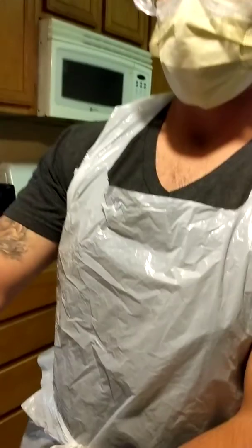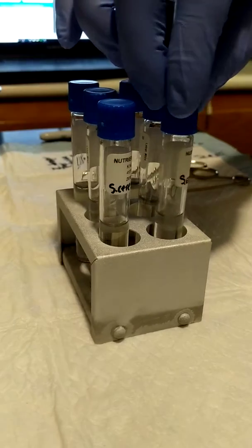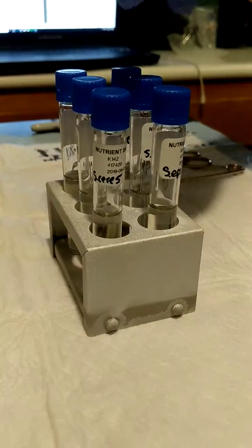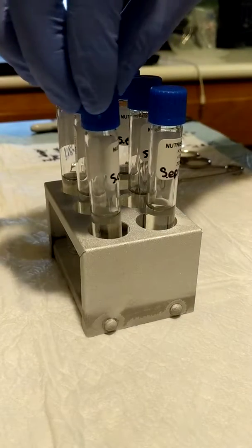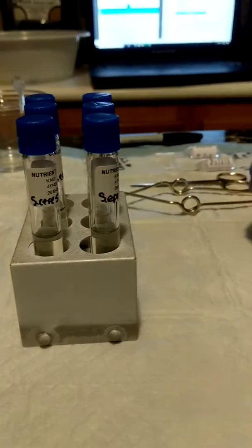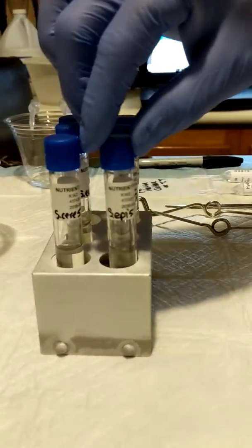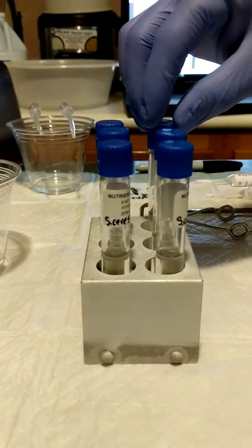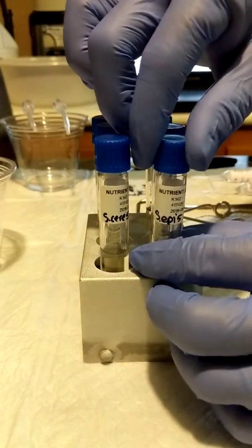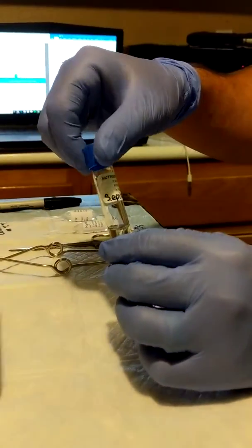So we're going to be testing active cultures incubated in nutrient broths at pHs of 5, 7, and 9. It's going to be testing the Saccharomyces cerevisiae as well as the Staphylococcus epidermidis. They're all labeled. The 5 is acidic, 7 neutral, and the 9 is basic. So we're going to get started. We're going to start with the more acidic nutrient broth. We're going to get them to the pHs first and then add the active culture later.